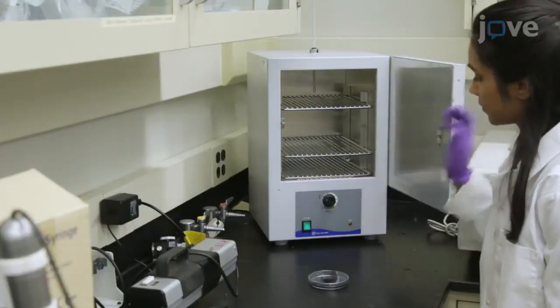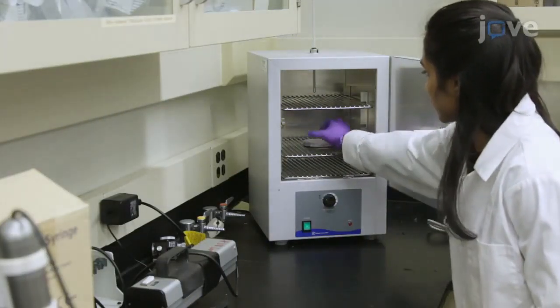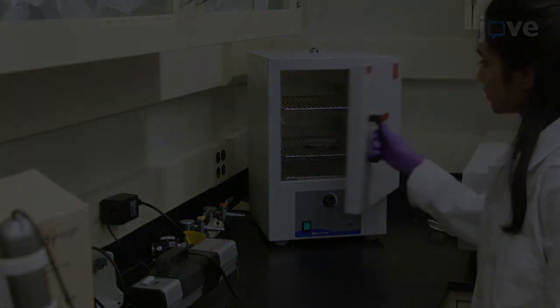Then incubate the covered Petri dish at 60 degrees Celsius overnight to cure the PDMS into a flexible material.